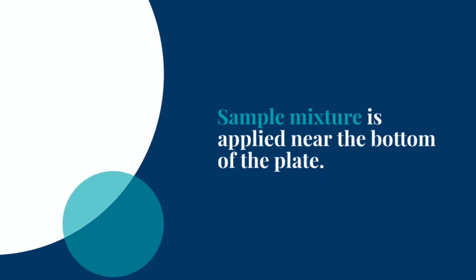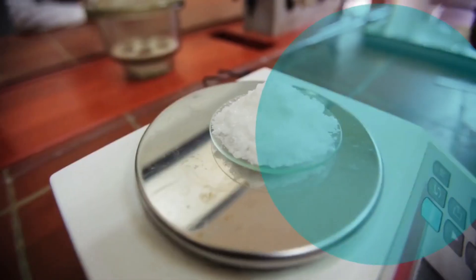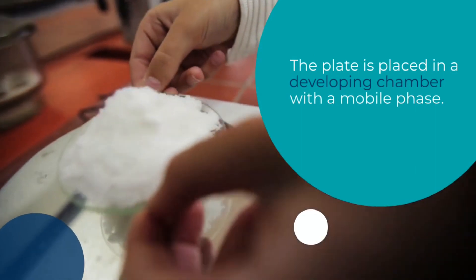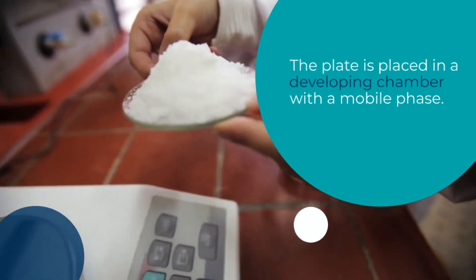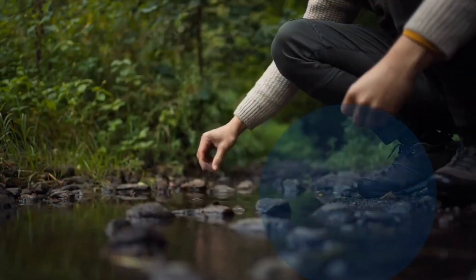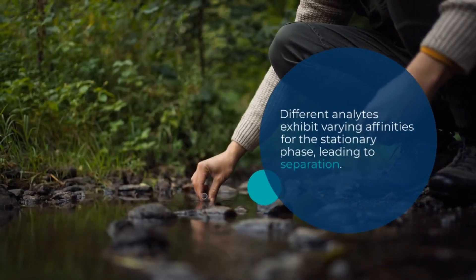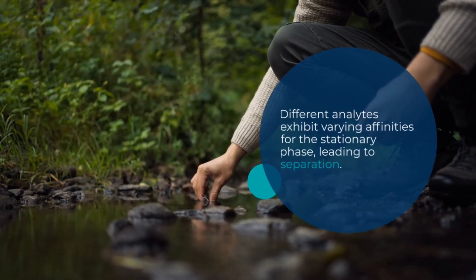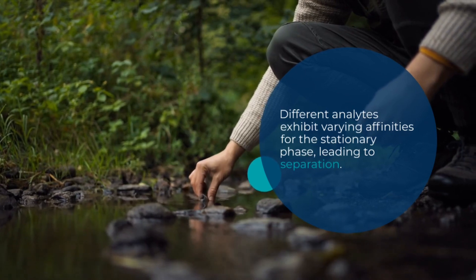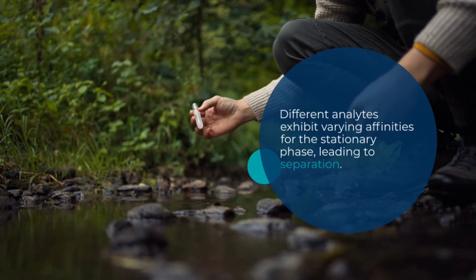Principles of High Performance Thin Layer Chromatography. 1. Stationary Phase: In HPTLC, a thin layer of adsorbent material, known as the stationary phase, is coated on a glass or aluminum plate. Silica gel, alumina, or modified forms of these materials are commonly used as the stationary phase. The choice of adsorbent depends on the nature of the analytes and the separation requirements.